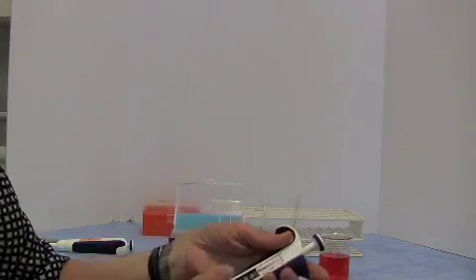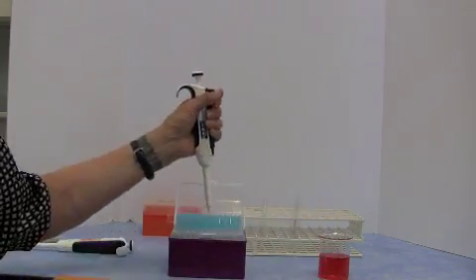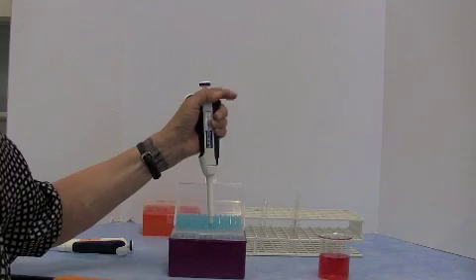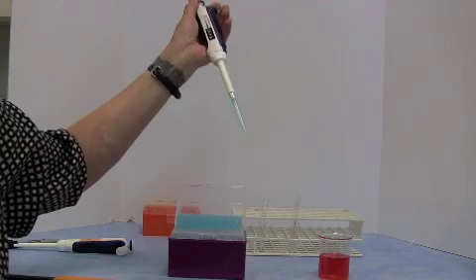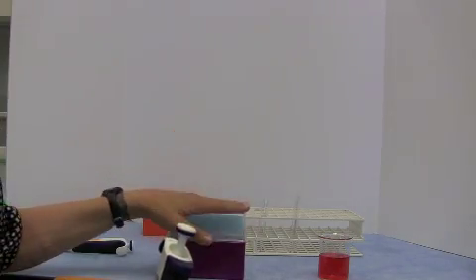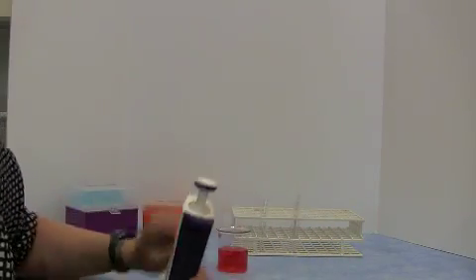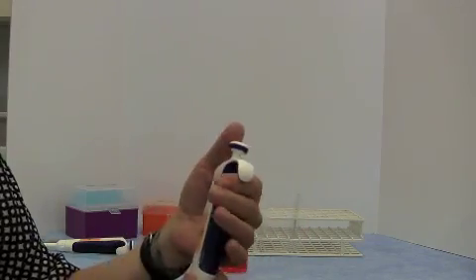So we make sure that our pipette is set to the correct volume. You push the pipette onto a pipette tip, like that. Just push it down and you'll see it should be firmly seated on the end of the micropipette. Close your pipette tip box, get it out of your way. Now we're going to put liquid into the tip. So again, check you've got the right volume.